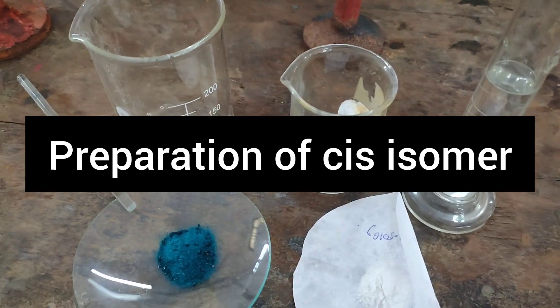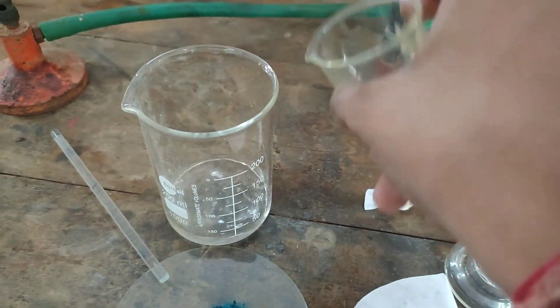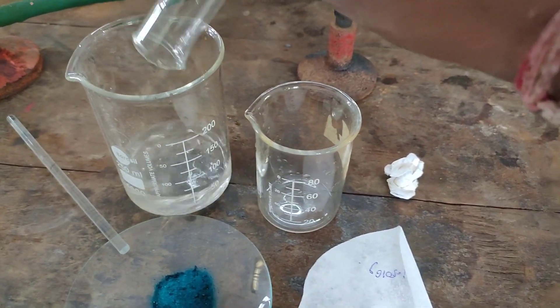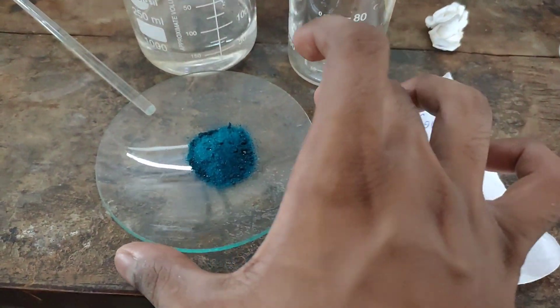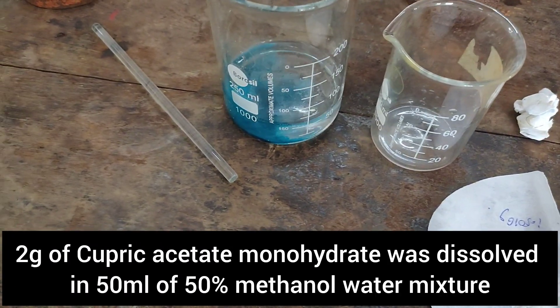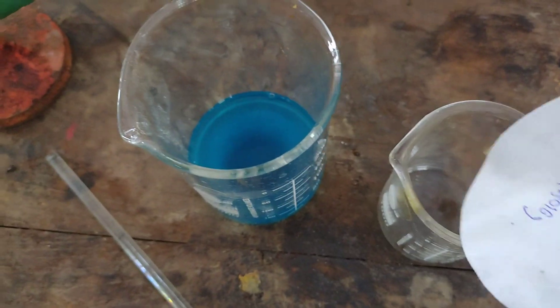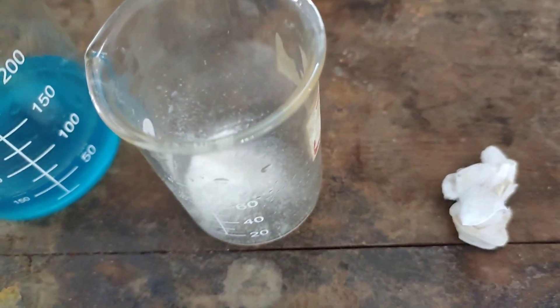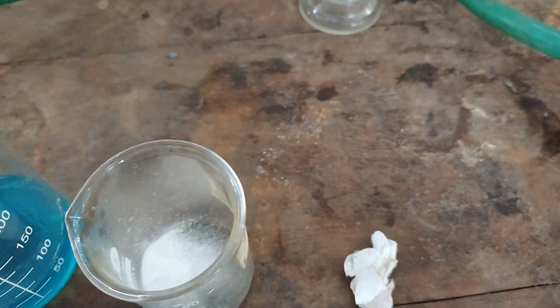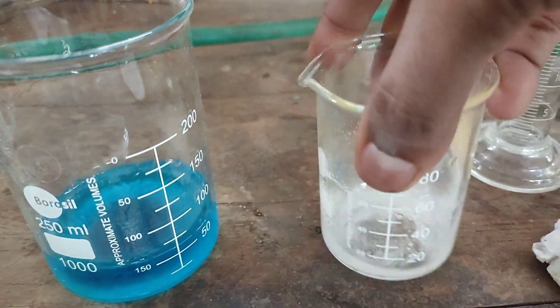To prepare the cis complex, first a 50 ml 50% methanol-water mixture was prepared by adding 25 ml methanol to 25 ml distilled water. Then, 2 grams of copper acetate monohydrate was added to this solution. Also, 1.5 grams of glycine was weighed, transferred into a beaker, and dissolved in 10 ml of distilled water.